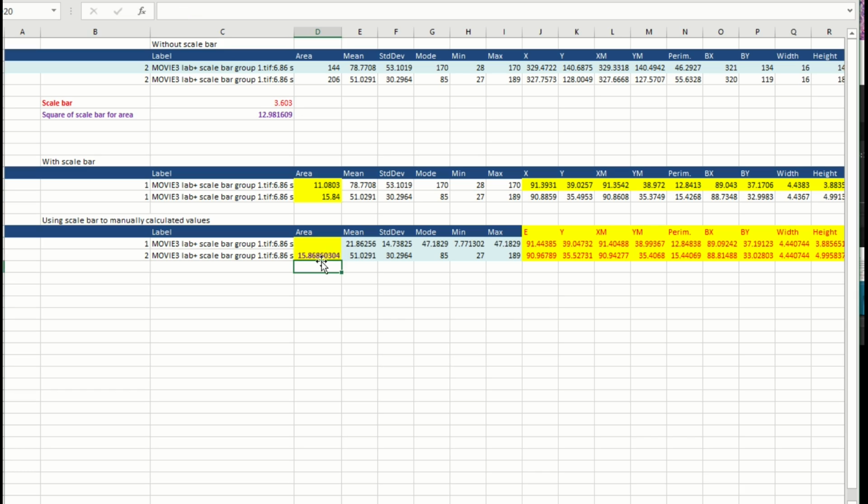Let me delete it again very fast. 12 divided by the square. Here I have the dollar symbol. The idea is that when I drag this, I will be measuring this one, but I keep the same square of the scale bar, and I get a relatively similar value. Again, if I have the same scale bar in both measurements, I will have the same thing. And this is how you correct the data.